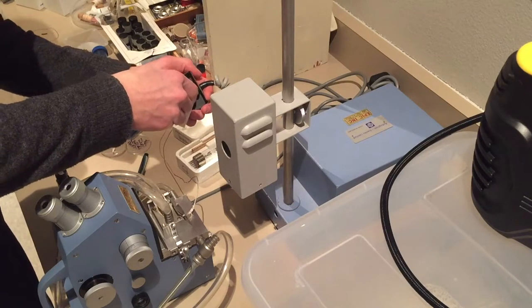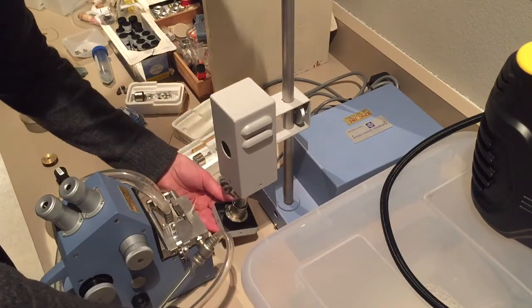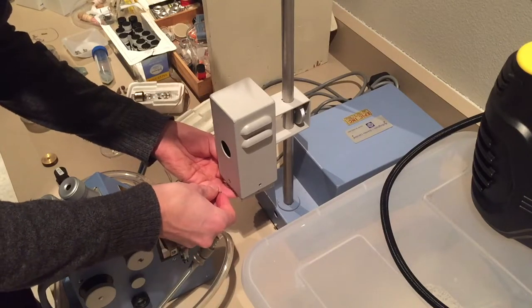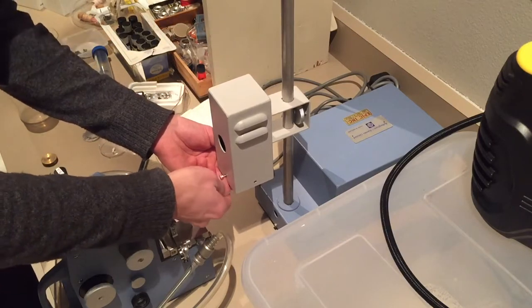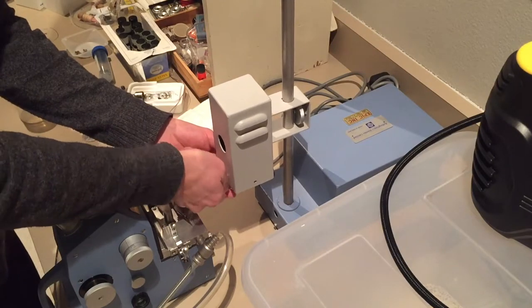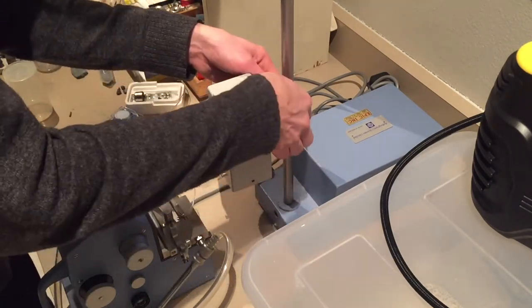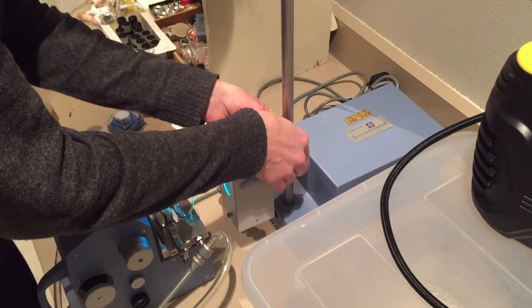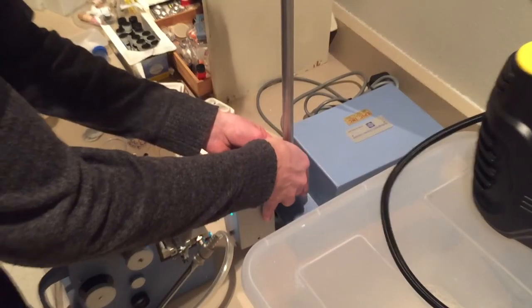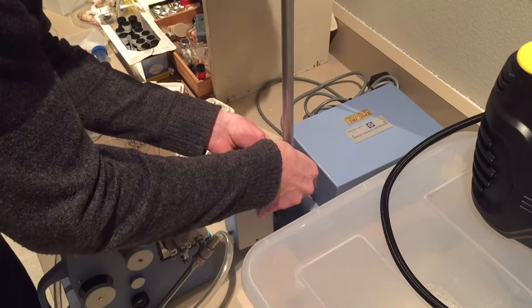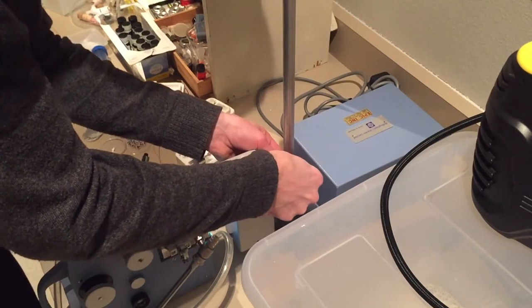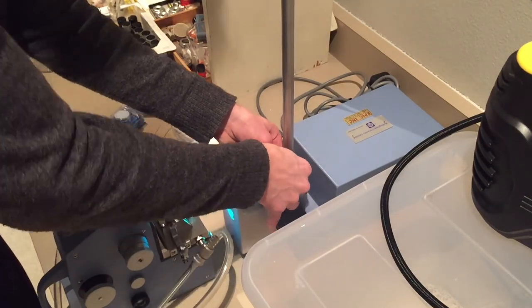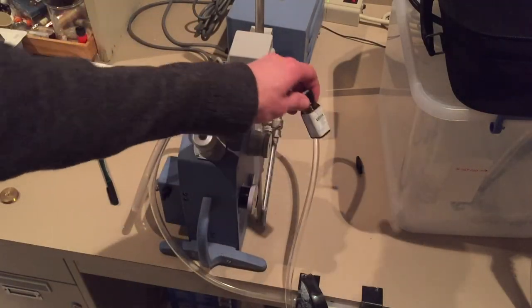The spreadsheet has the option set up to do this type of calibration, specifically for this type of refractometer. This is a Bellingham and Stanley critical angle refractometer. That just means it uses the critical angle to find the line where light refracts through and away from the liquid. This calibration depends on the wavelength of light and the refractive index of the prism as that changes with temperature and wavelength. There's a lot of factors to keep track of.